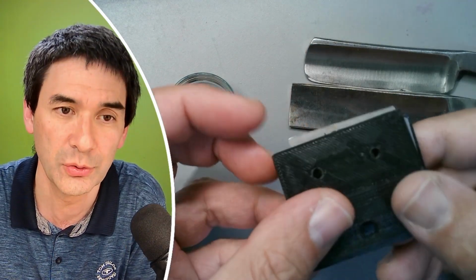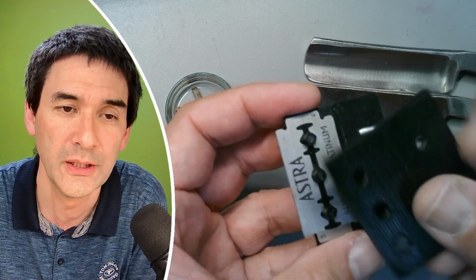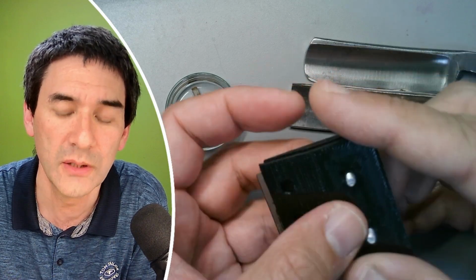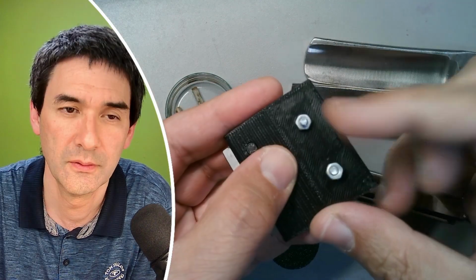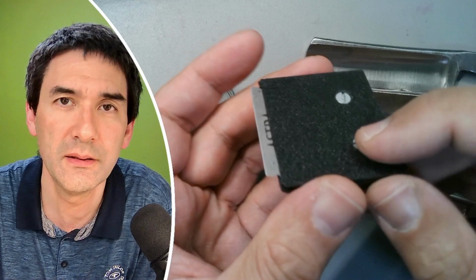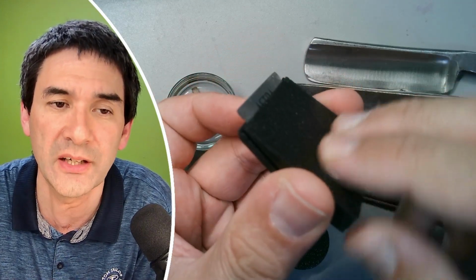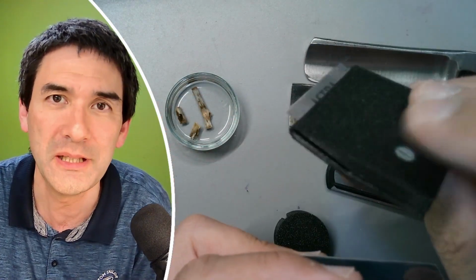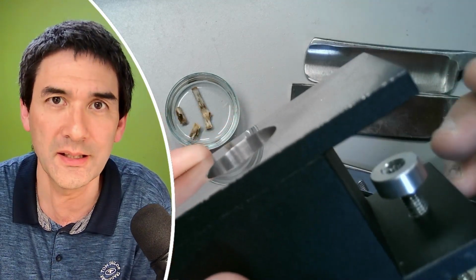Okay, so that goes on top here. By the way, if you also want to download the file, oh, it's the other way around. If you also want to download the file, yeah, please check the links below. You can download an STL file if you want to, and then there are two screws that go in here. So, and number two. And what I've done is the following. I've actually made those holes here a little bit deeper, so that the screws don't stand out. Otherwise, they would scratch the surface of the Microtome. But because they're now a little bit deeper, it's also not going to scratch. So I'm going to connect this now to the table, and then let's have a look.